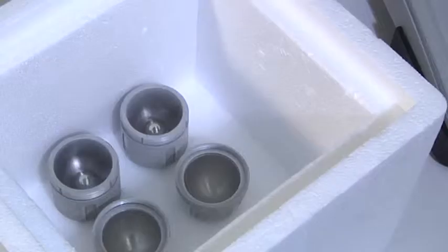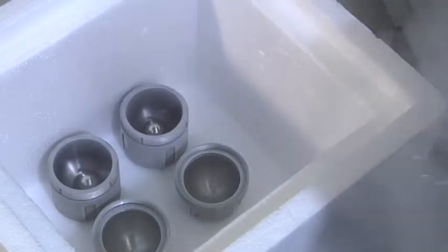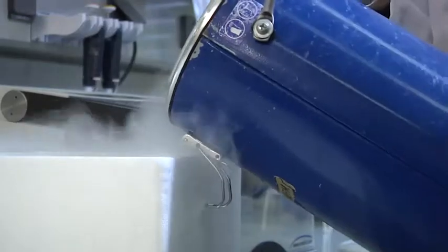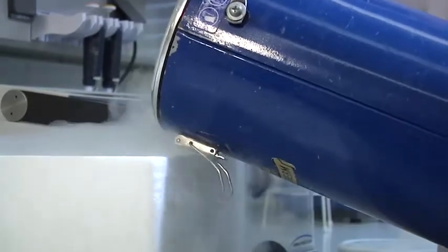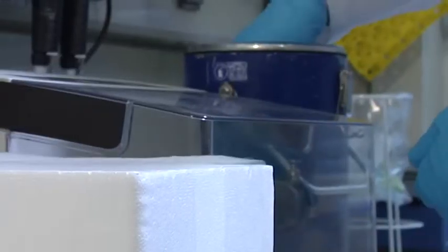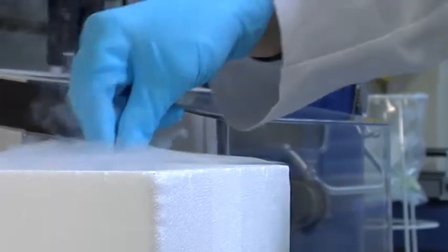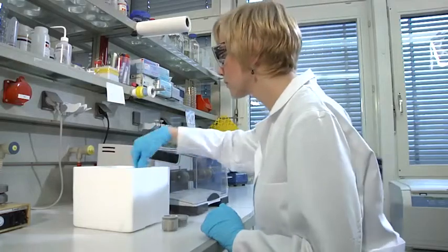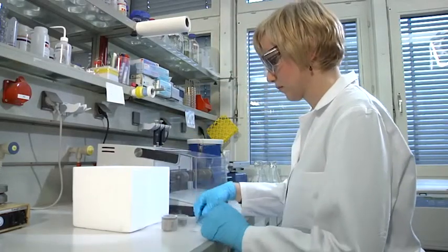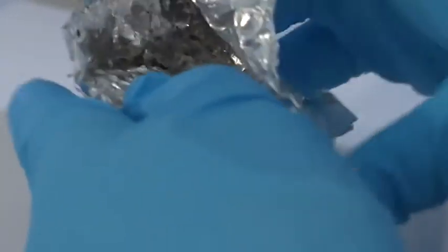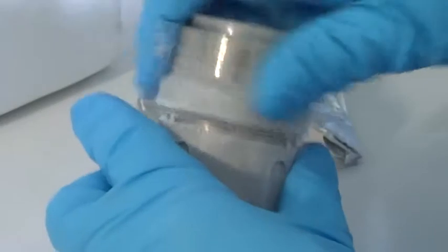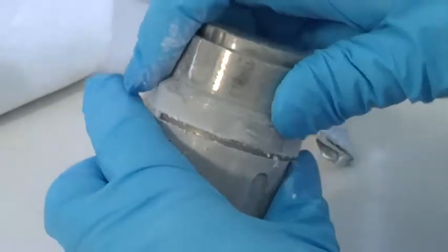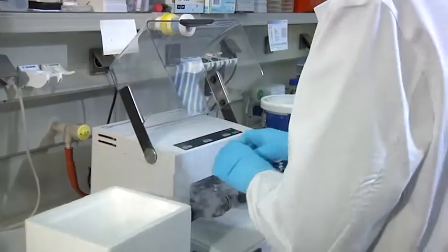Their envelope has to be disrupted to release their intracellular proteins. The centrifuged cell material is put into aluminum foil and shock frozen. The cells are then transferred into a metal cylinder containing a metal ball. The cylinder's function is comparable to that of a mortar and pestle when it is attached to the shaking machine.